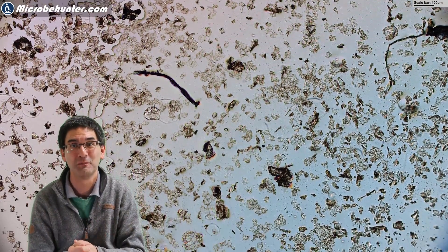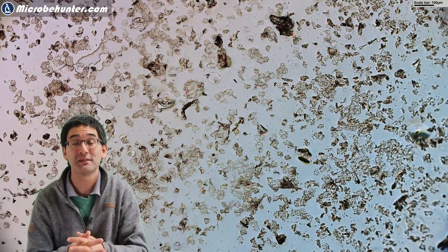Sometimes, if there are too many of them, well then you have to go to the dermatologist to get them removed. I tried all the other parts of the face and with a little bit of patience you are able to find them again.